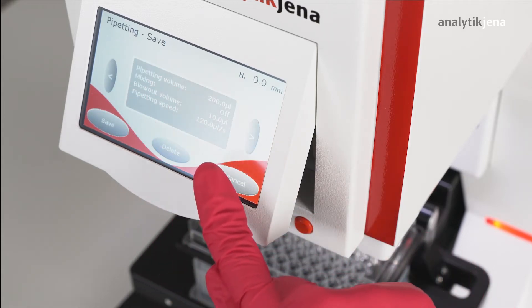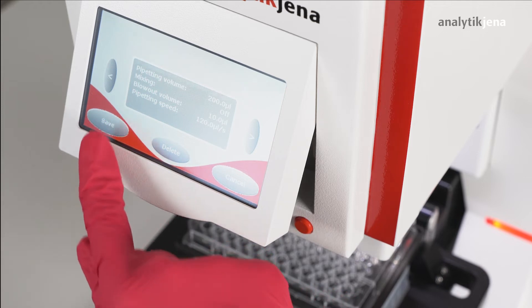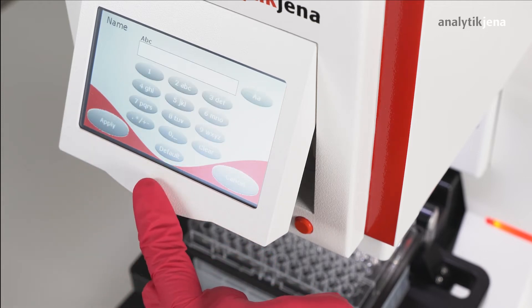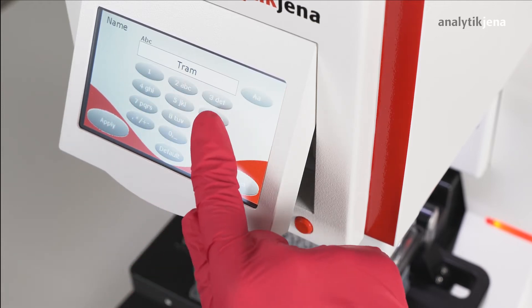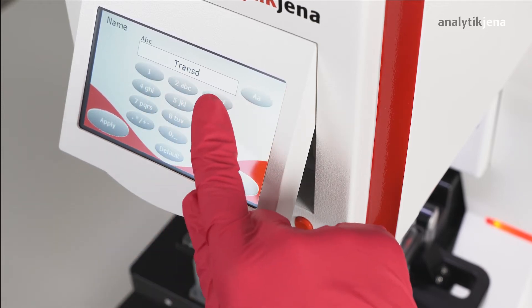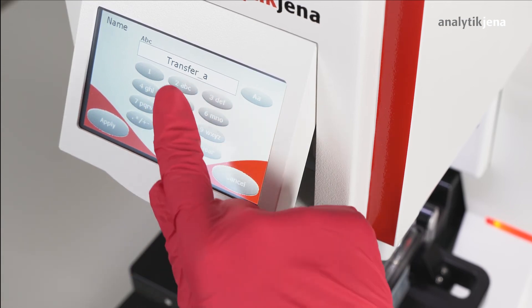Once the method has been completed, it can be saved. The set parameters are displayed for checking before the user assigns a name — for example, 'Transfer 200'.